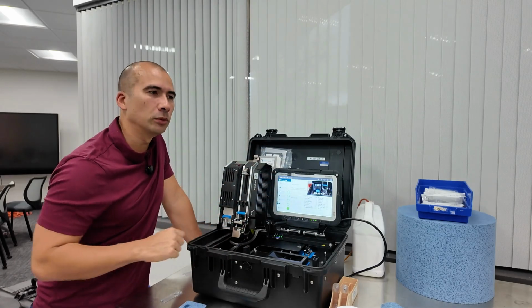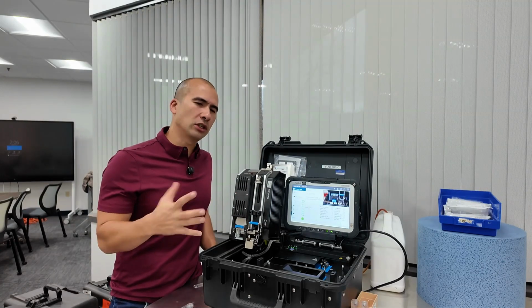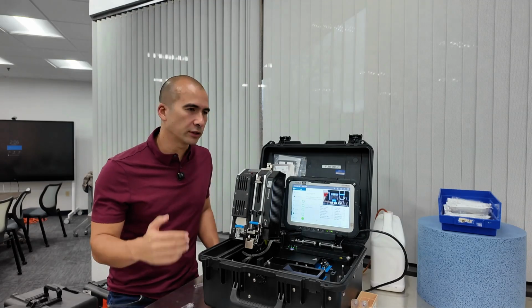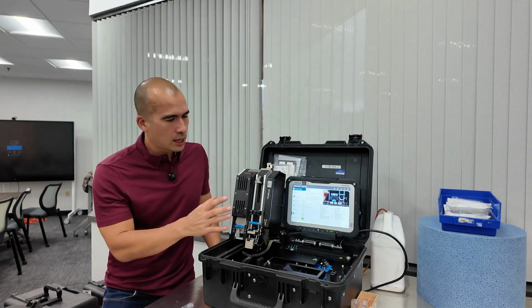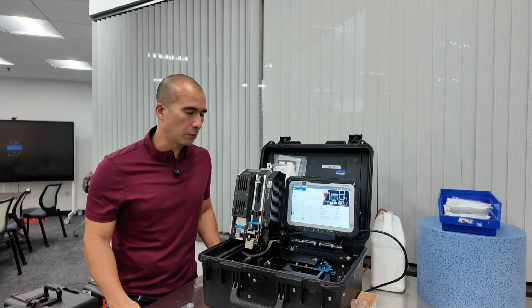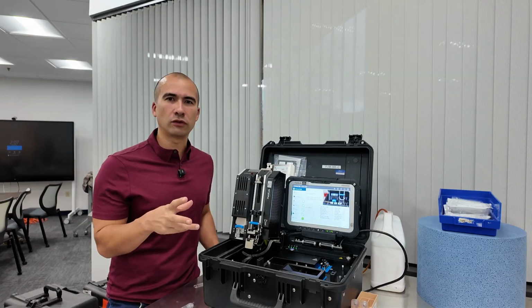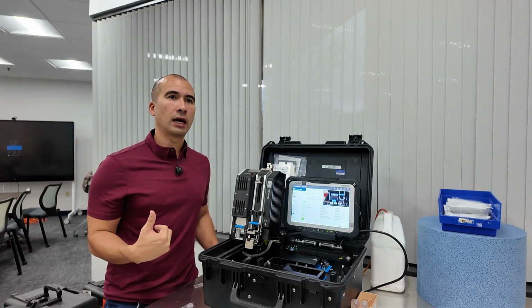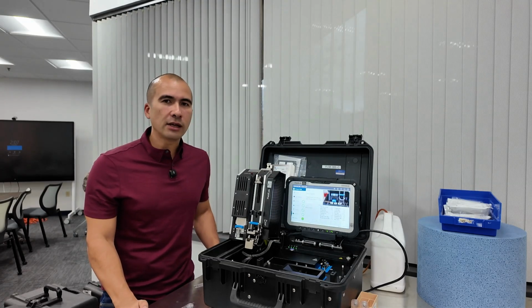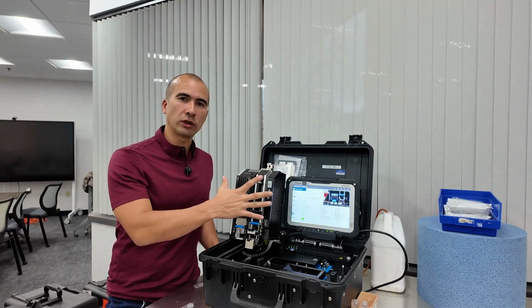FieldLab 58, super useful. Now, this is XRF. So what are the limitations? Like, when would you use XRF versus a standard ICP type oil analysis, whether it's rotating disc electrode or OES? I think each of these different technologies has a bit of a place. XRF, for example, is going to be a little less sensitive to particle size, where your standard ICP we usually say tops out at an average of about 10 microns in size. So that's one of the strengths of XRF.